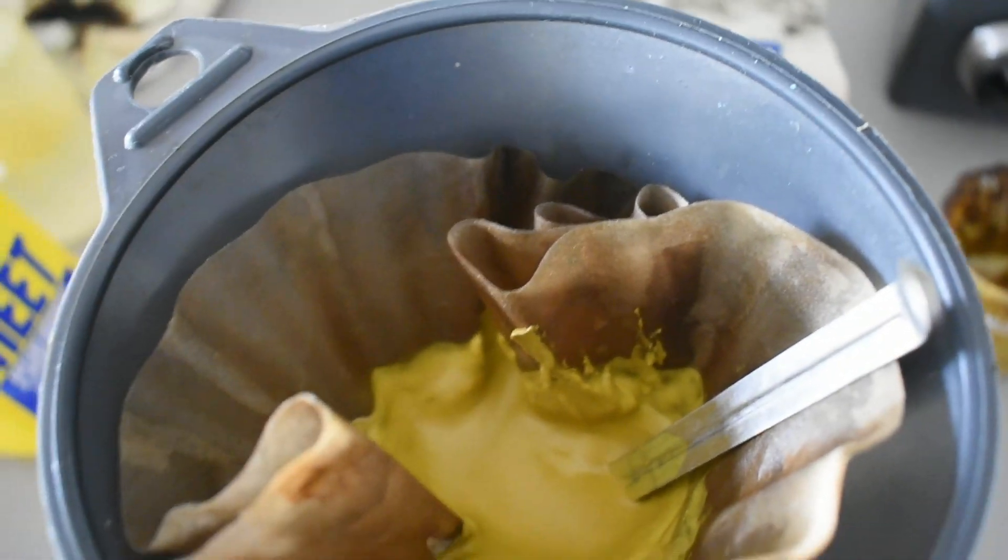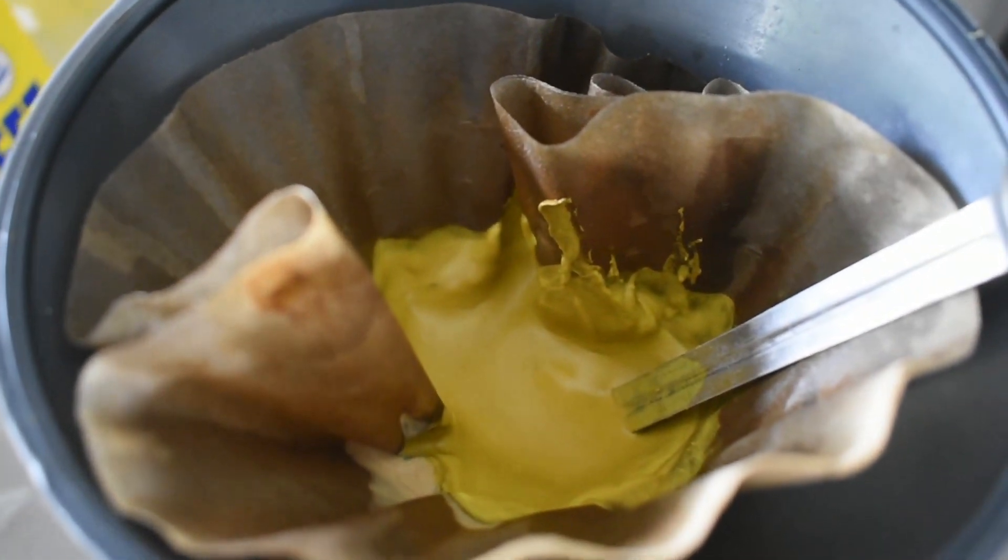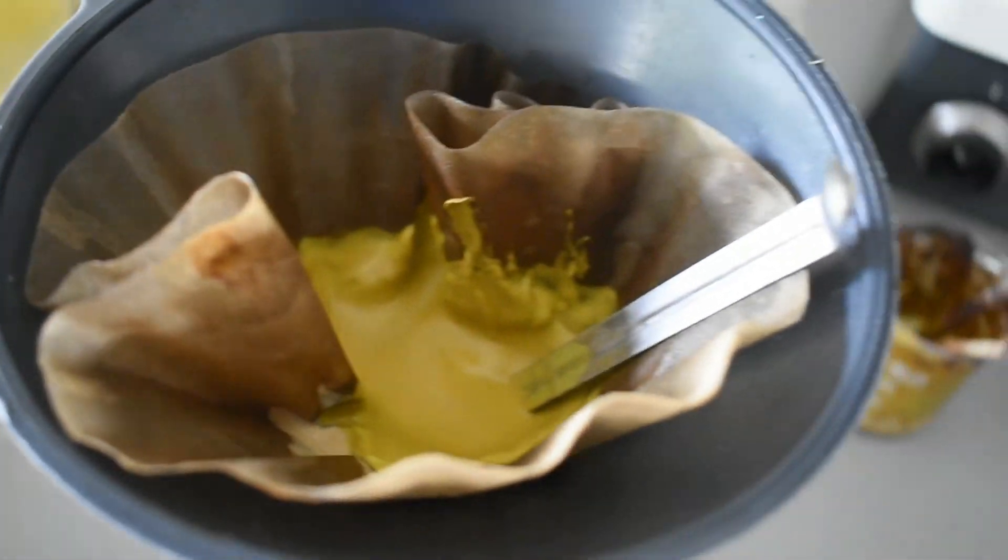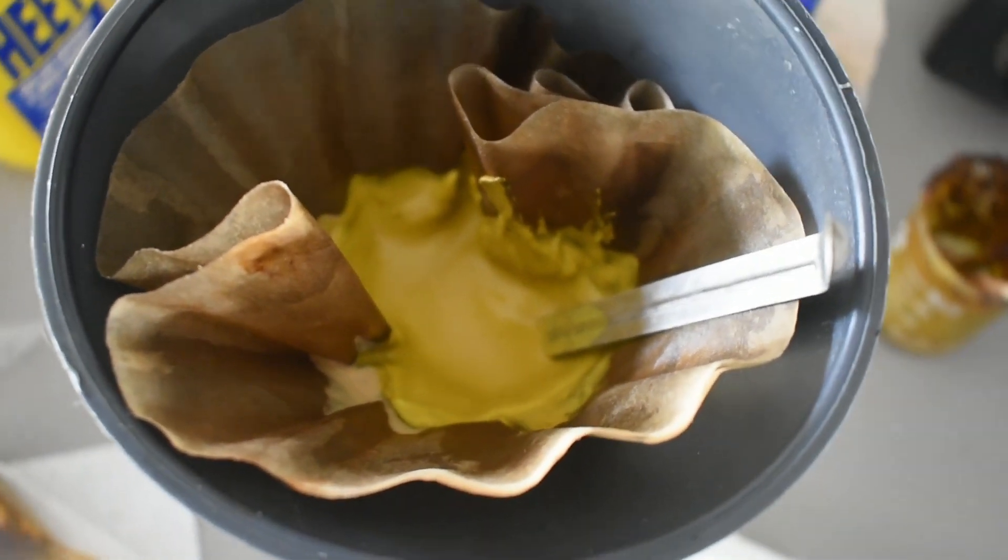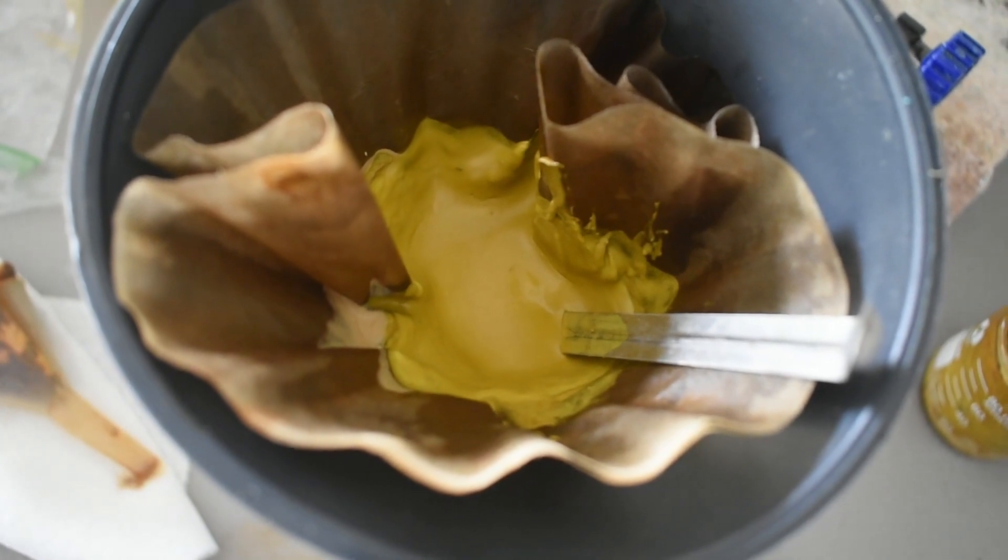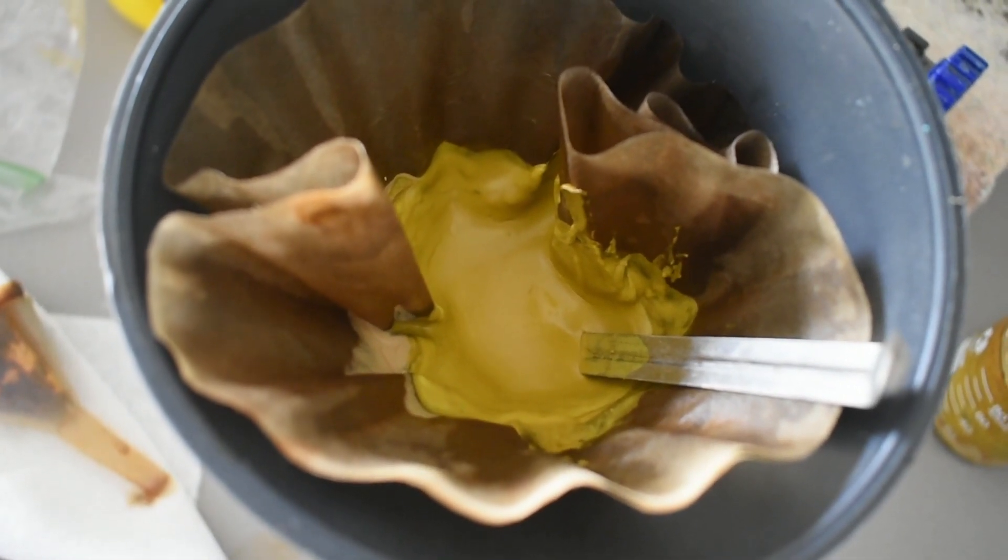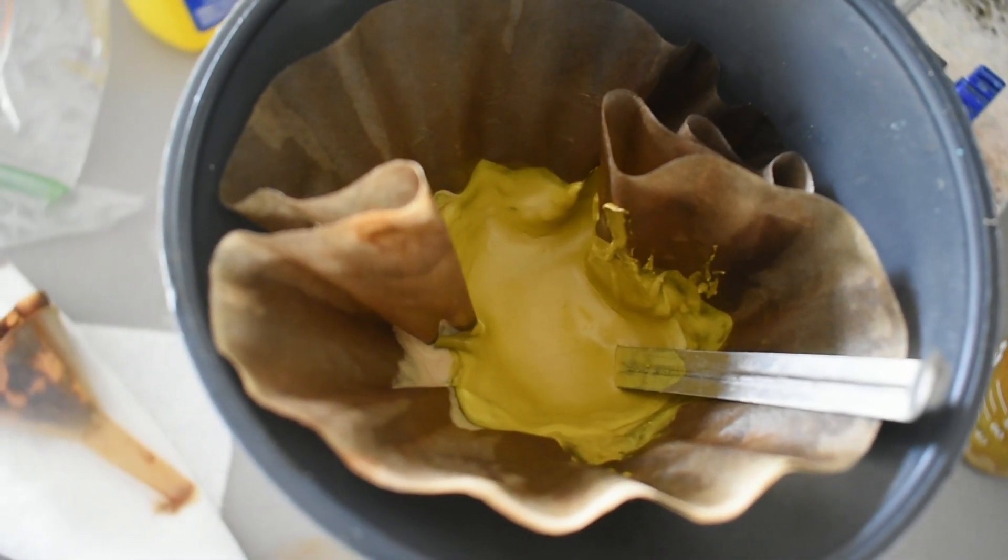Actually I might have too much for a vial. I'll see what storage containers I have. Probably should have prepared this beforehand. But we learned lessons. And I will mass our product. And I'll report back once it's bottled and we have our final yield.